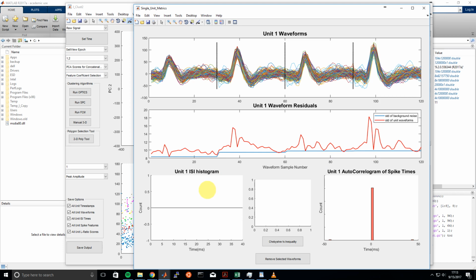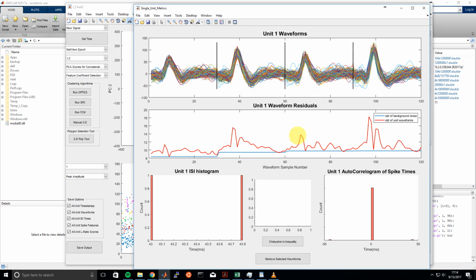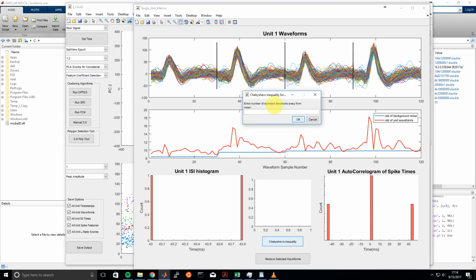Then we can also look at the ISI histogram here, and sometimes you won't get anything that pops up. So if you right-click the axis here, you can redefine the parameters of the histogram. So maybe I want to look at a histogram of 50 milliseconds and in 1 millisecond bins. And so now when we click OK, we can see that there's only actually 2 spikes that have less than an ISI of 50 milliseconds, but there are no refractory period violations at all. Then we can also quickly look at the autocorrelogram of spike times, and we can see that there's no random noise here, no chance of unit contamination, so that looks good.